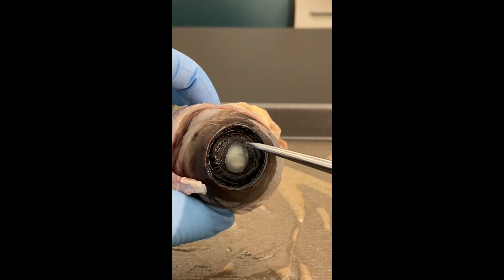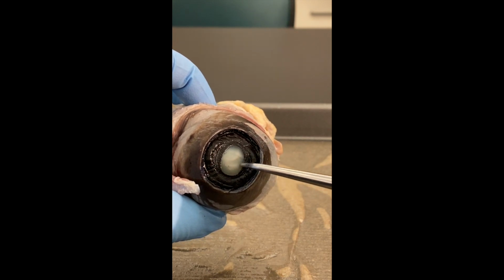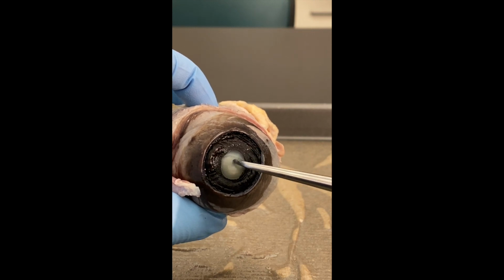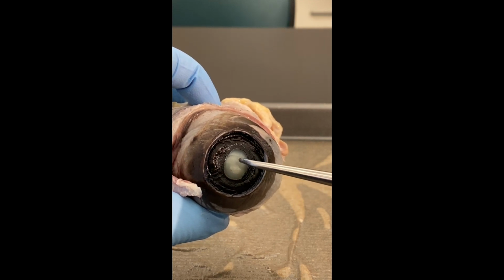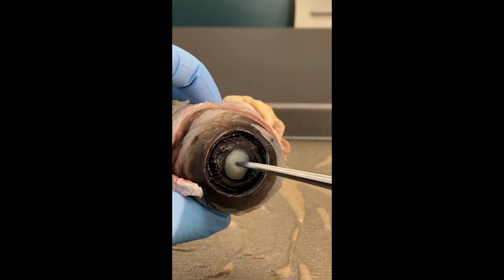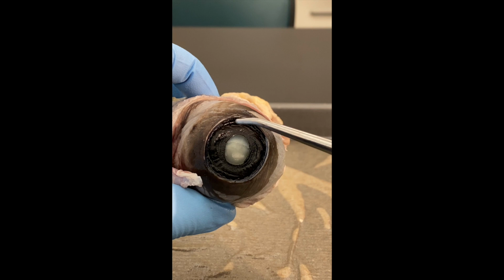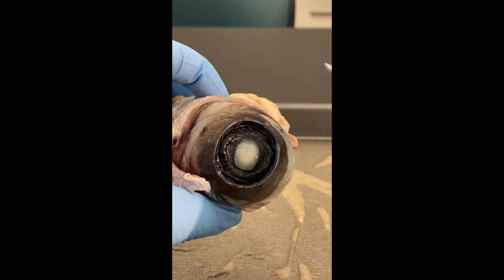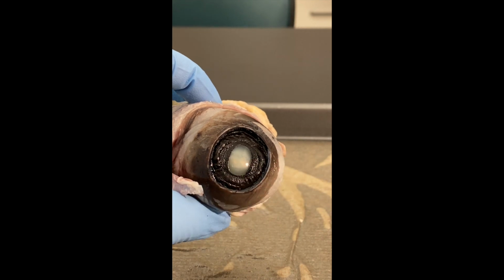So next we can see that we've got an opening here at the center of the iris. That is called the pupil. So the iris controls the diameter of the pupil, and directly behind, or what's in the opening, is this round structure that's called the lens. So even the lens is usually clear, but again, because it's been exposed to the formaldehyde of the preserving solution, it denatures and it clouds up like this. So what we're going to do next is we're going to take off the rest of the anterior cavity structures, and take a look at what's behind the iris here.